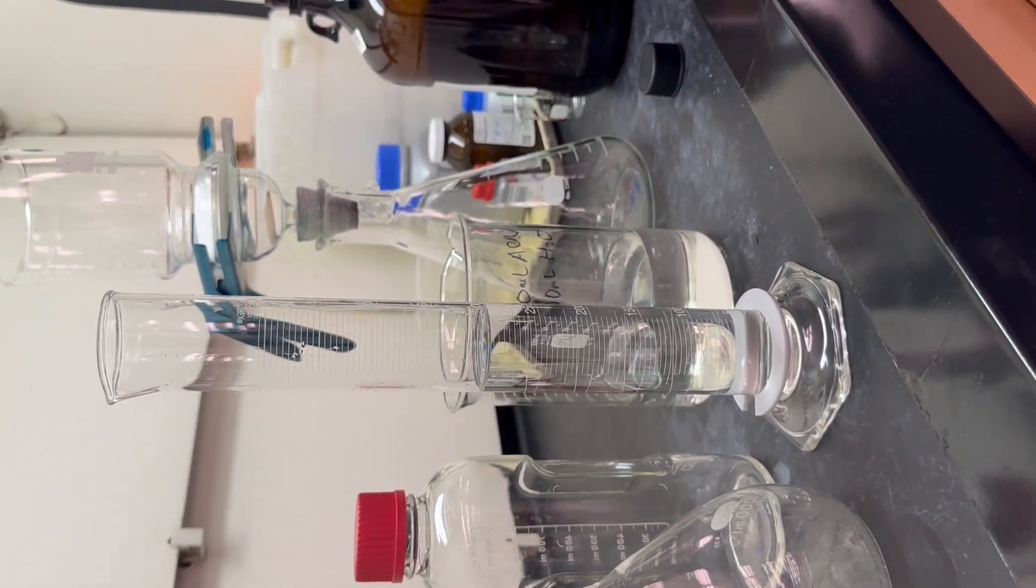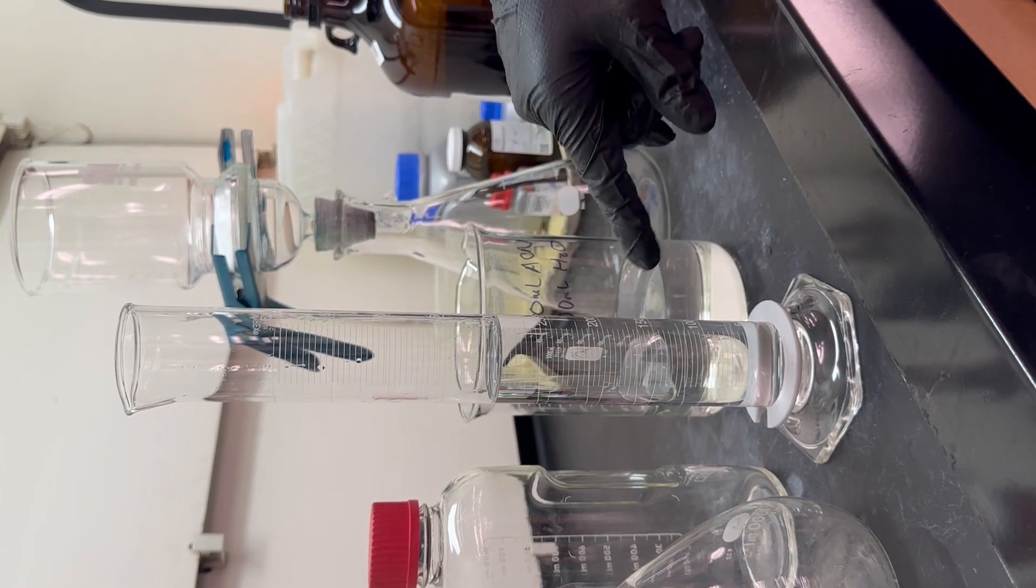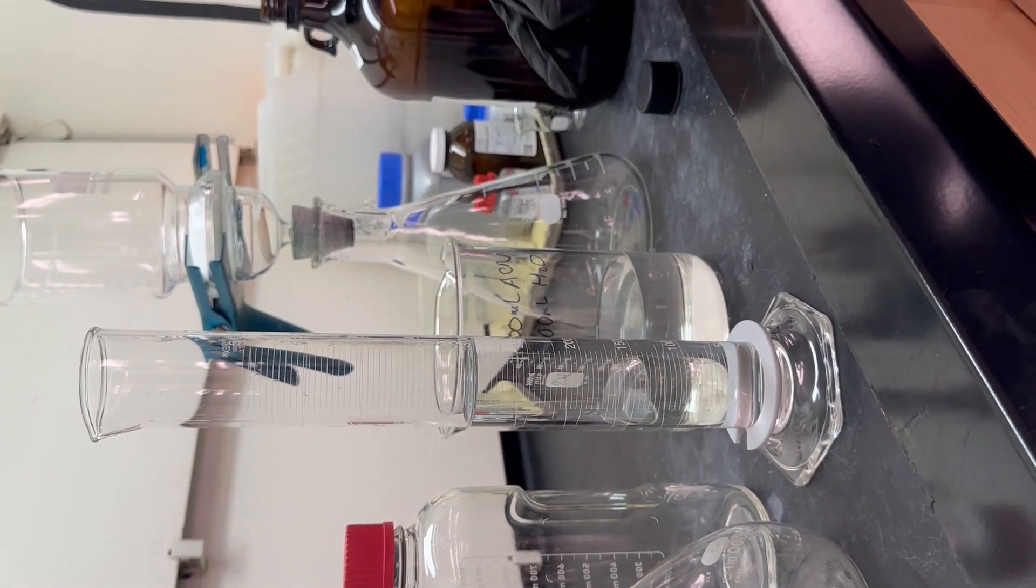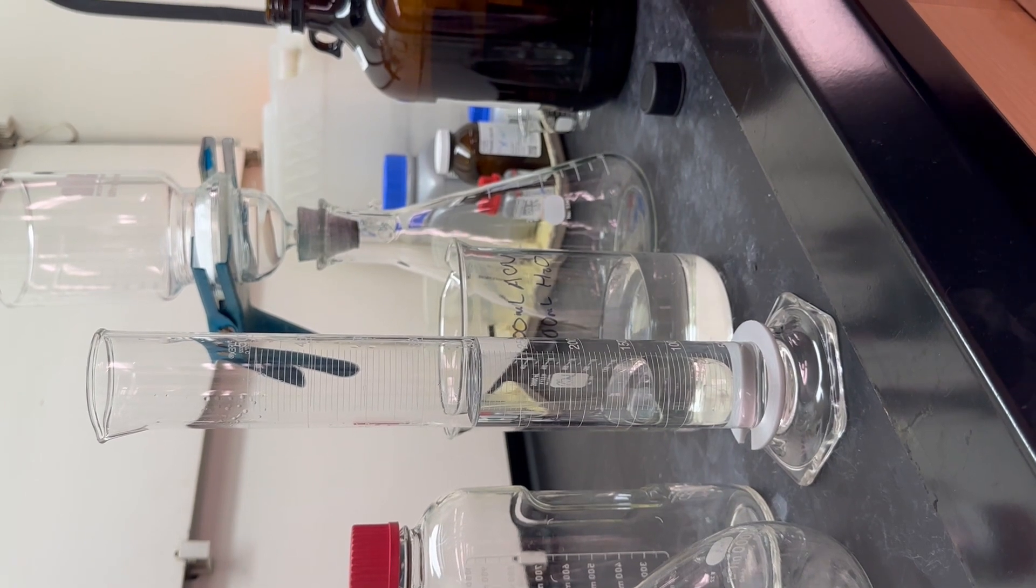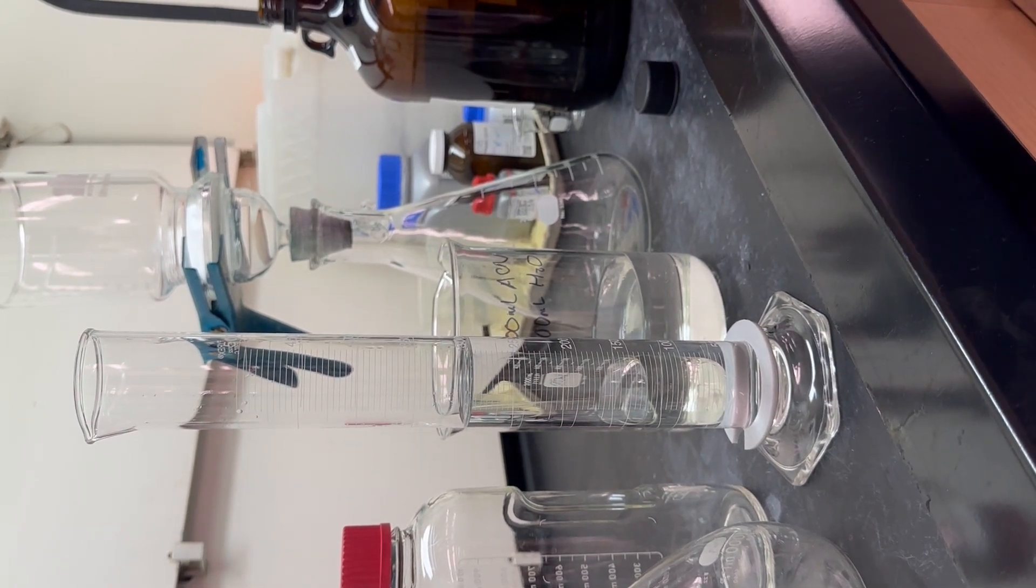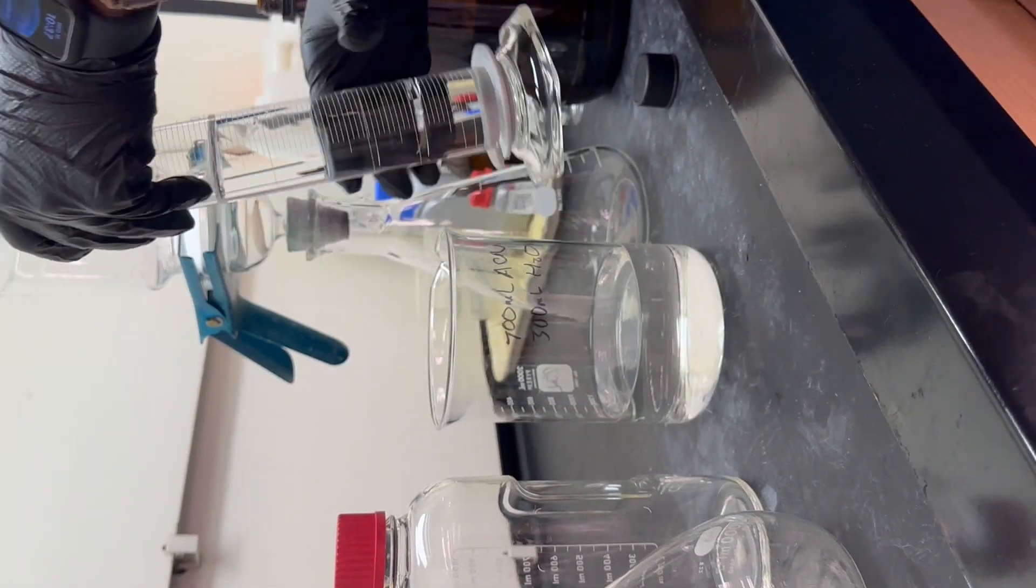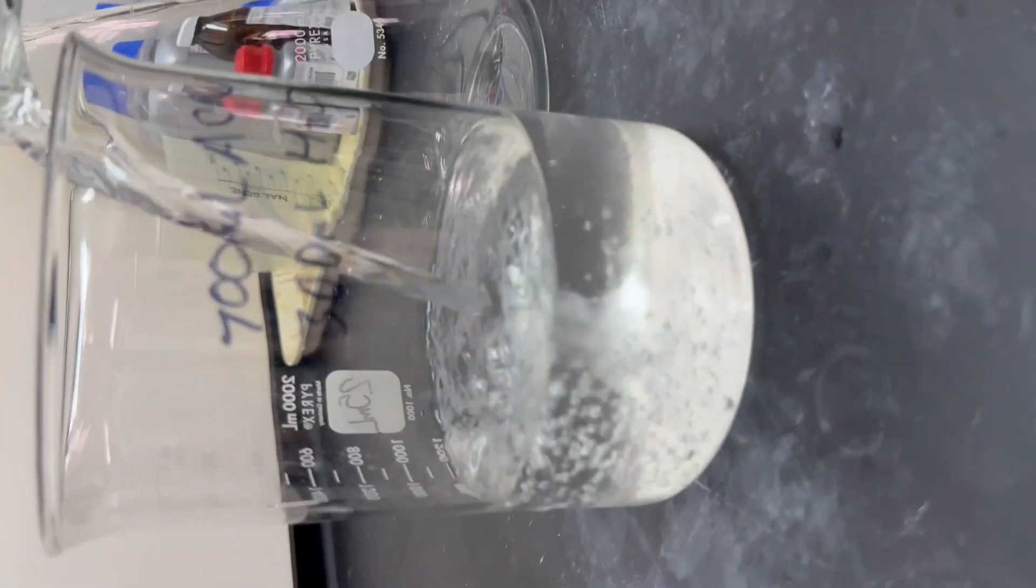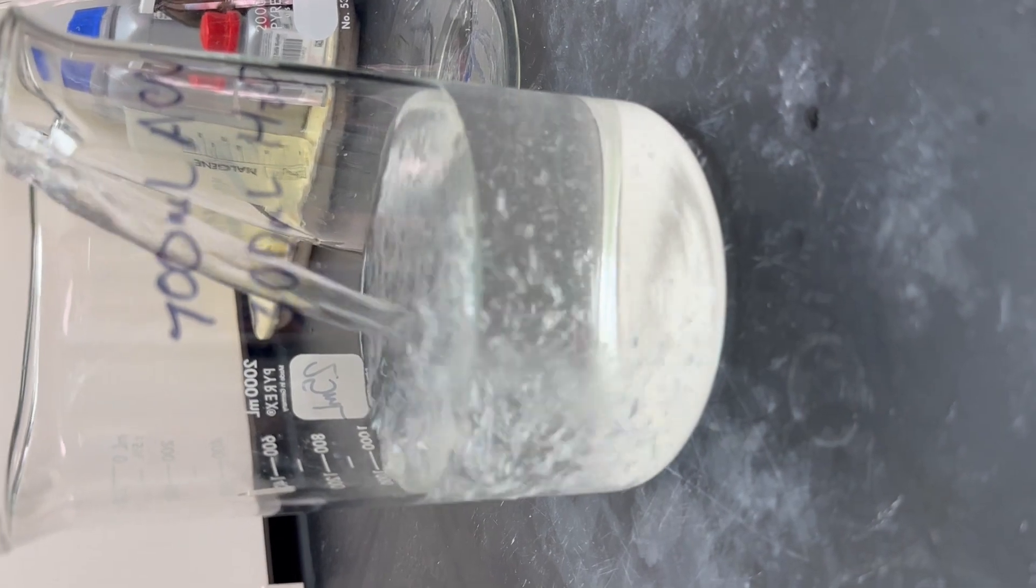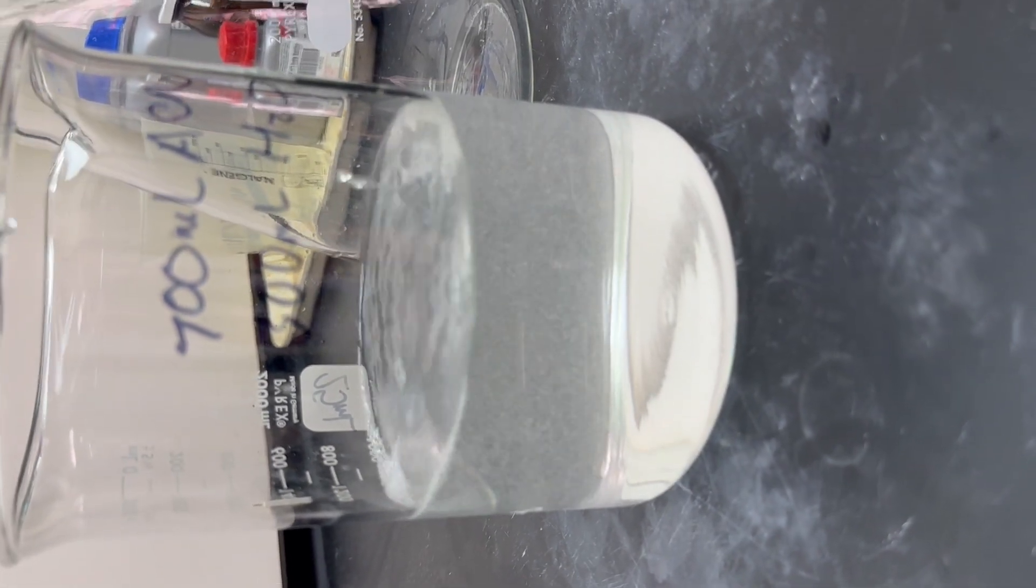This is important. When we add aqueous and organics, we will always have bubbling. That bubbling is important to remove before we put it into the instrument, or else we're going to have issues. Watch as we add this, see what happens. We'll see the opacity increase because there's turbidity due to the bubbles.